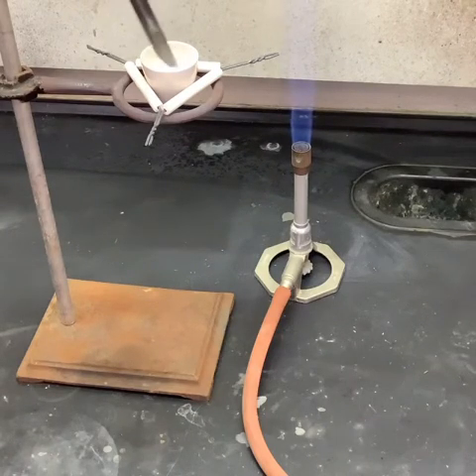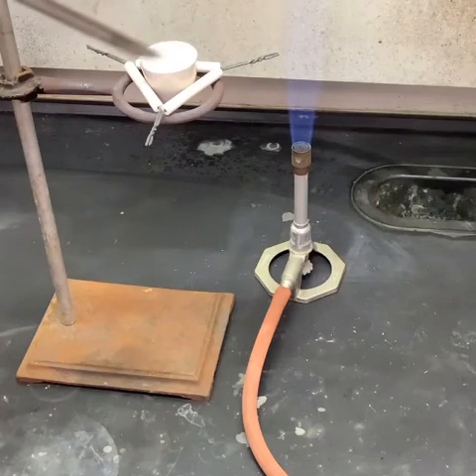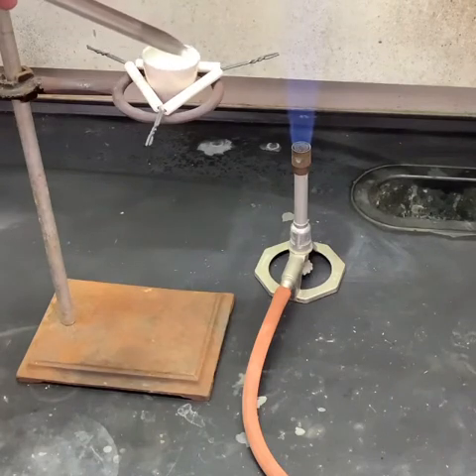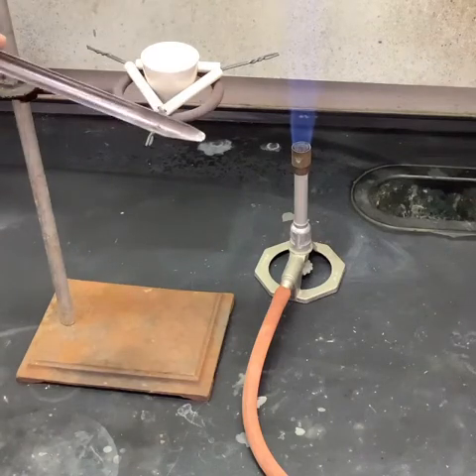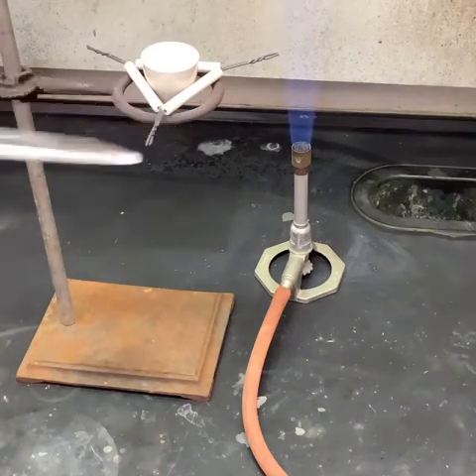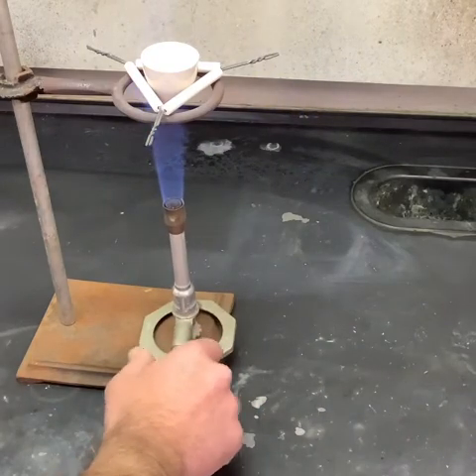Sometimes those clumps trap and sort of protect the center. Try and leave as much of it in there as we can. We might lose a tiny little bit of mass when we start stirring. We can see that on the tip of the scoop we're going to have a little bit left behind. Hopefully our sample size is large enough that it won't be noticeable though.